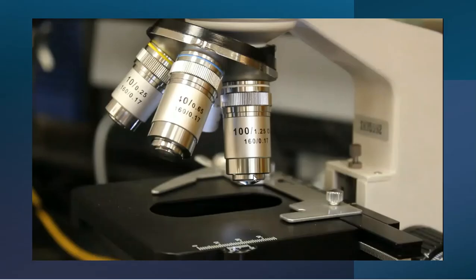All right, guys. I think it's important to know that everyone uses a microscope in a different way, and this is just the way that I have become comfortable with using them. My method and my process might be a little different than someone else's, or maybe yours. Once you get in there and play around with the microscope, you will find what works best for you. And for me, this is what works best when I begin looking at slides.